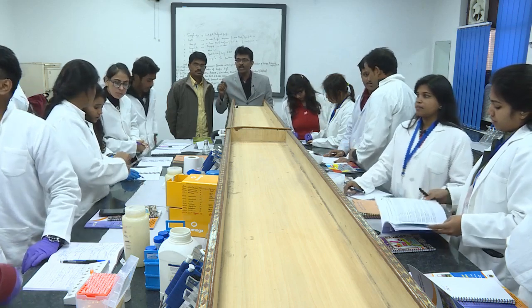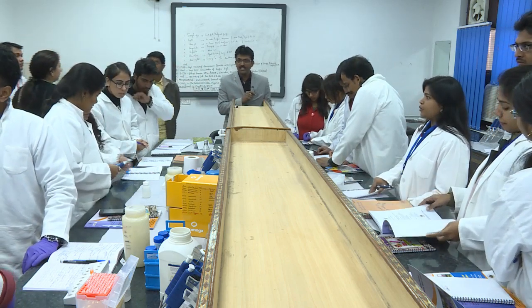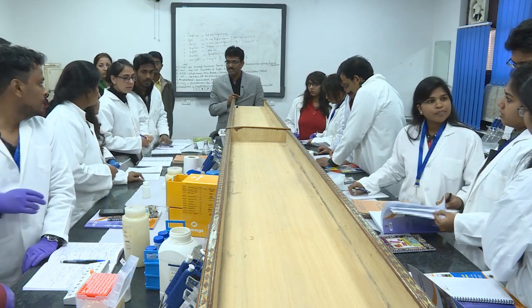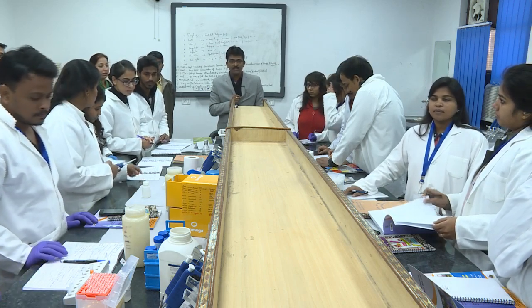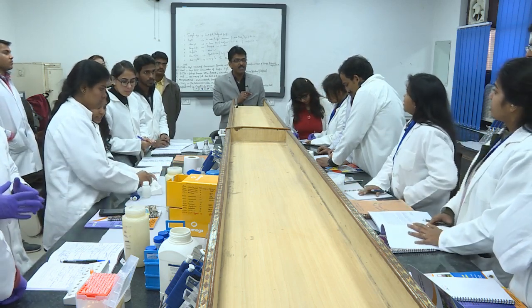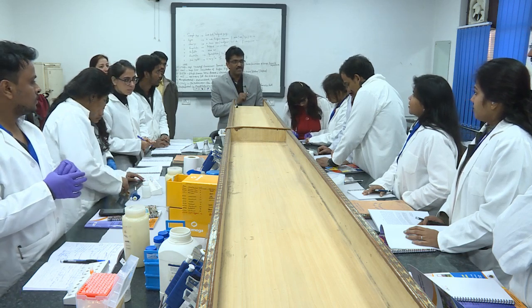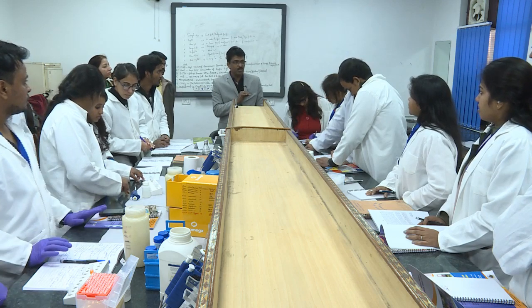Any other group who has reached this quantitation stage? Not yet. For the kit based method, you should be ready now. Okay. What about the other group? Laboratory method? Okay. 10 minutes drying is enough, right? Now you add TE 10:1 now.